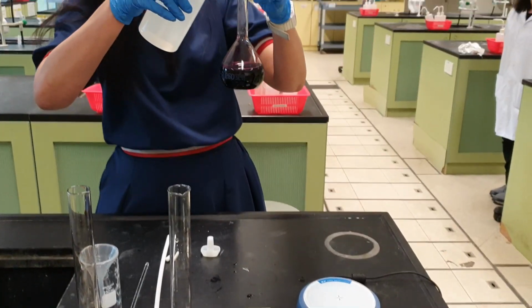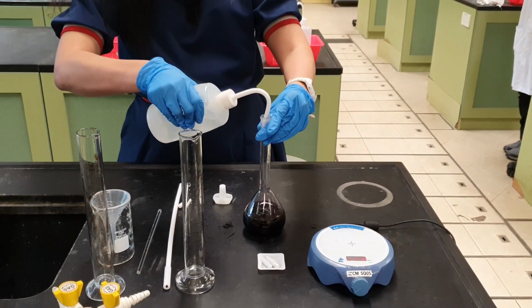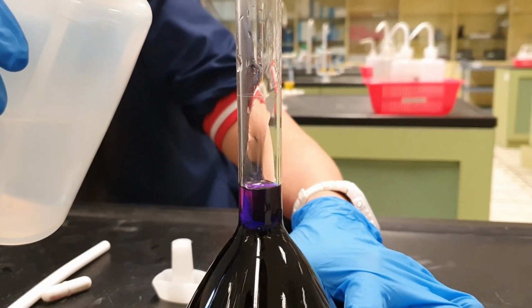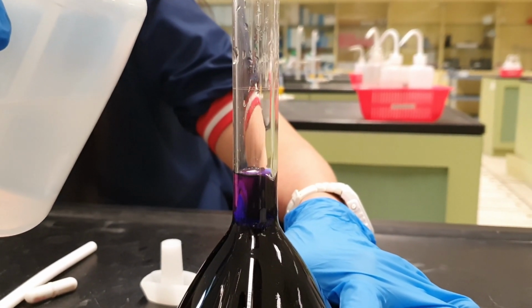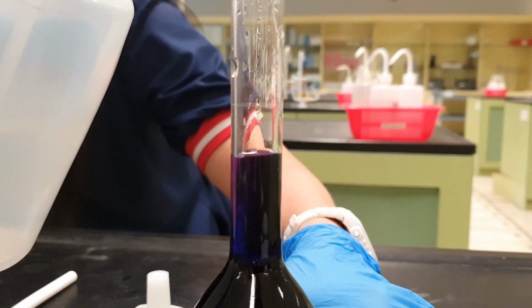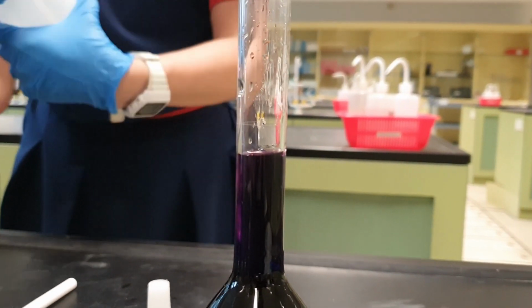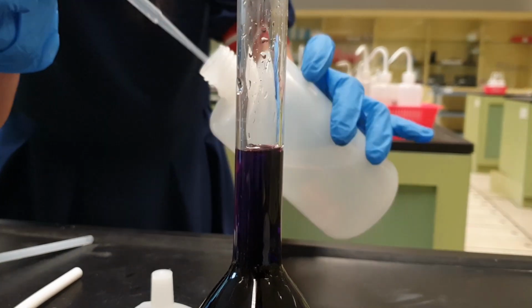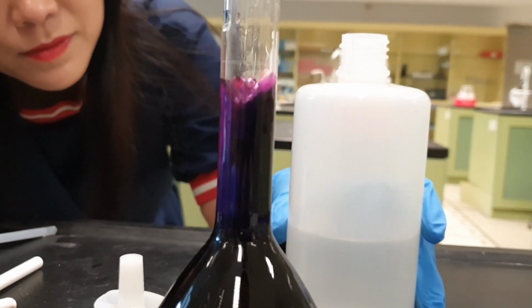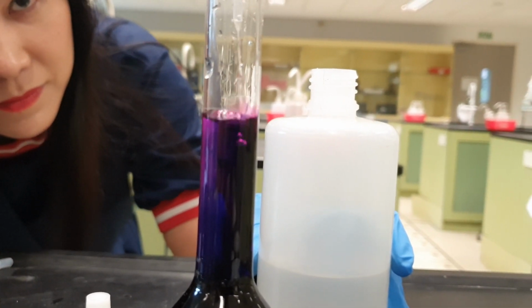If you are preparing potassium permanganate, please do not acidify the solution at this stage, because the acidified solution is less stable during storage. Fill the volumetric flask with distilled water to the line indicated on the flask. As you are approaching the line on the volumetric flask, add distilled water dropwise using a dropper to prevent overshooting the line. Read the meniscus at eye level to minimize parallax error.